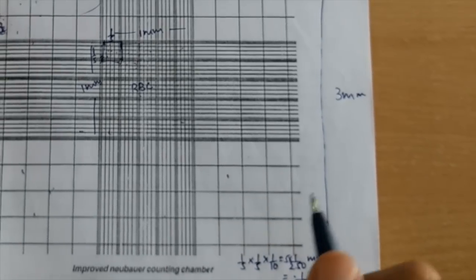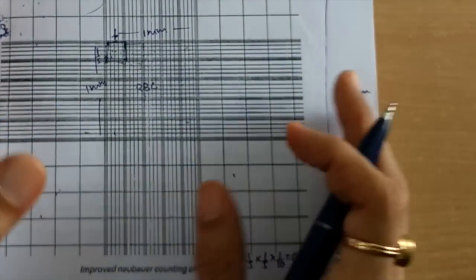Now let us focus the same chamber in the microscope and discuss more about the chamber. Now we are focusing the counting chamber. This is the lowest magnification, 4x. We are not supposed to count RBC or WBC in this magnification. This is just to visualize this chamber. You can see here, as we have seen in the picture, these are WBC counting squares. This is one, this is second. So four corner squares are there which we have seen. This is third one and this is the fourth one, and this central one is for RBC counting. So this is the RBC counting square and these four are WBC counting squares.